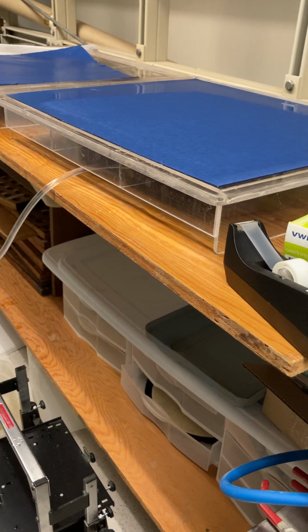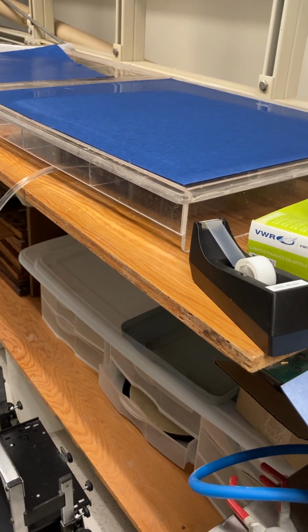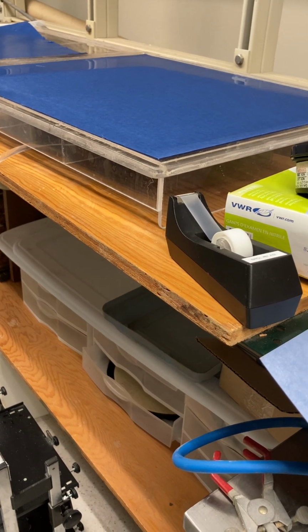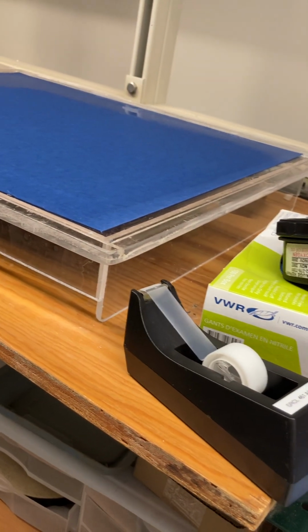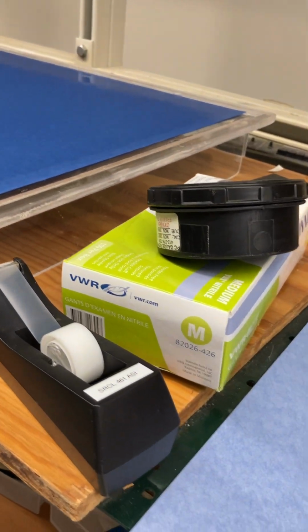Oh, yeah, and it turns out that sometime next week is the class, so you could keep it running till then. Sure. Okay. You just have to make sure the paper stays moist. That's the important thing. Okay. And so far, it's looking good.